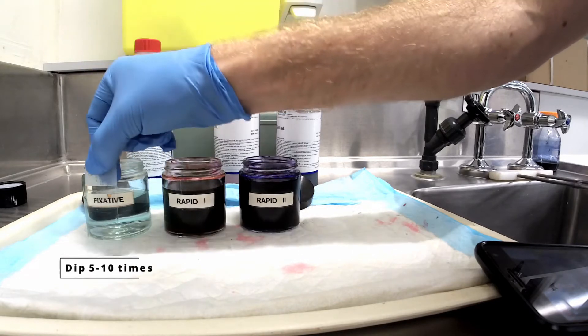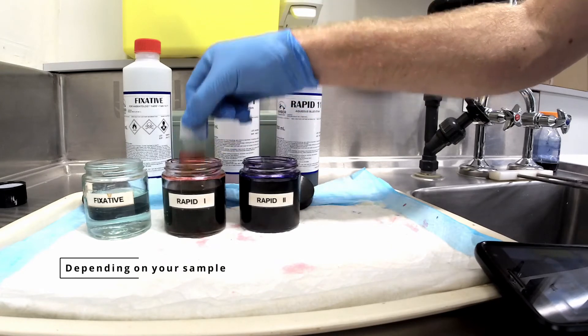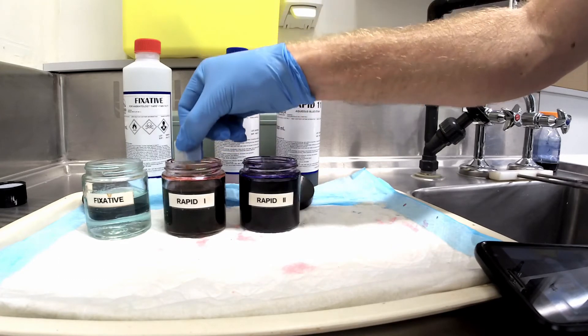Then, blot dry on the paper and repeat the process with Solution 1 and Solution 2.